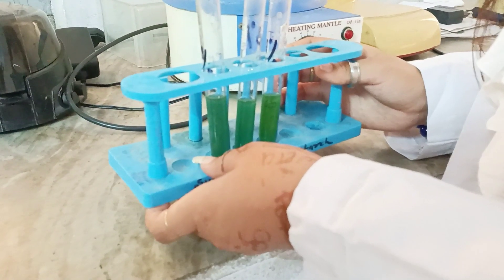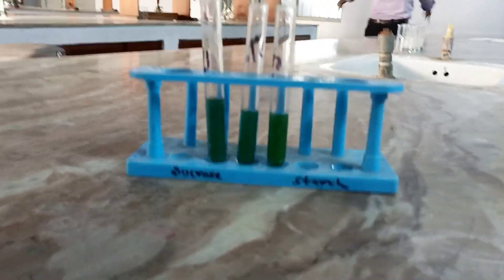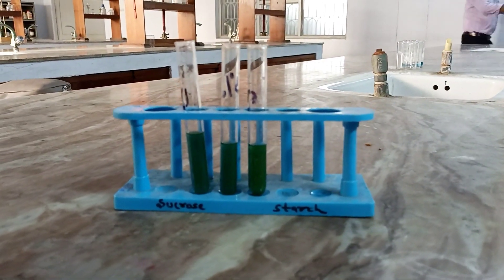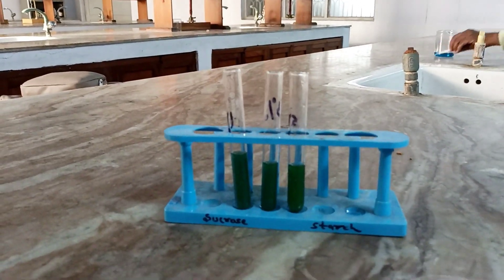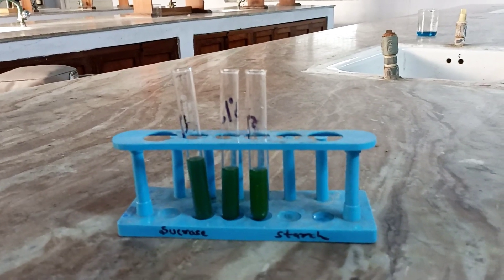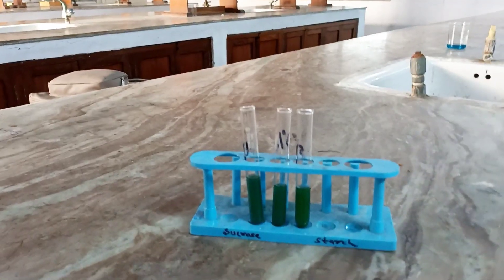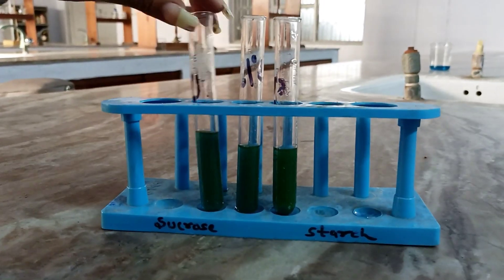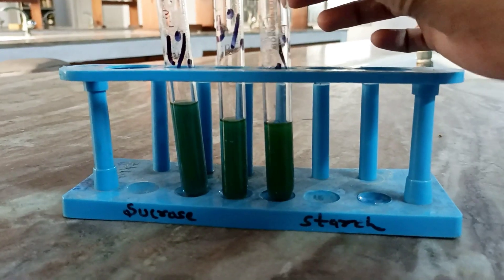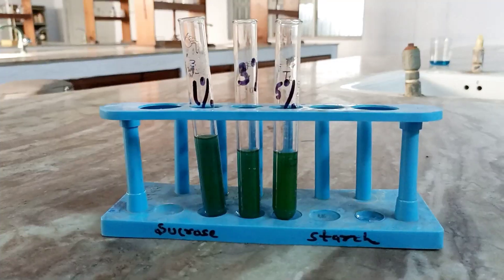So you can see that Shweta has removed the test tubes from the water bath and our result has also come. You can see that the color has changed — when we kept it, it was a blue color and now it is a blue-green color, which means that a carbohydrate is present. But we don't know exactly which one, because this is a qualitative test, not a quantitative test. If our concentration of carbohydrates is higher, it would be a brick red color. The concentrations already mentioned in the test tubes are 1%, 3%, and 5%.